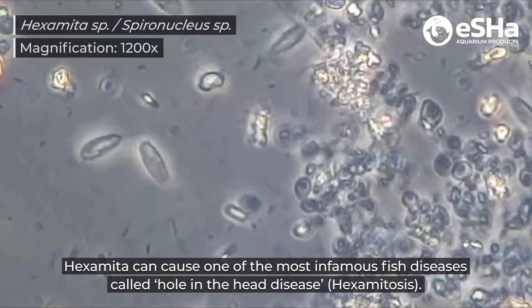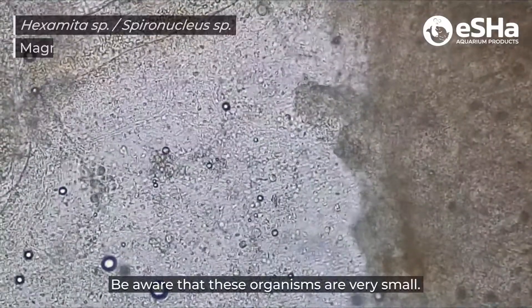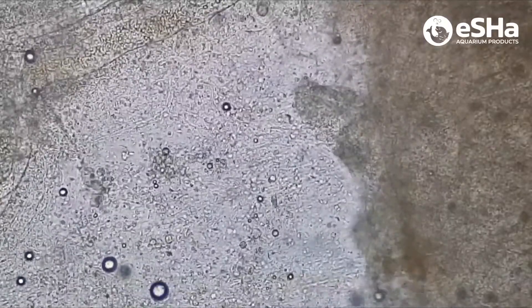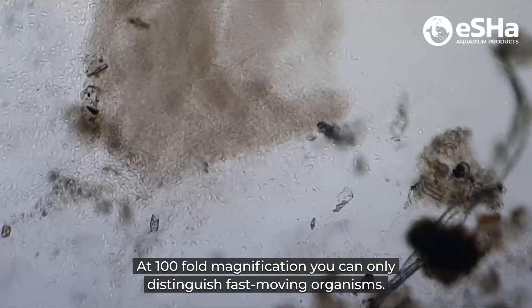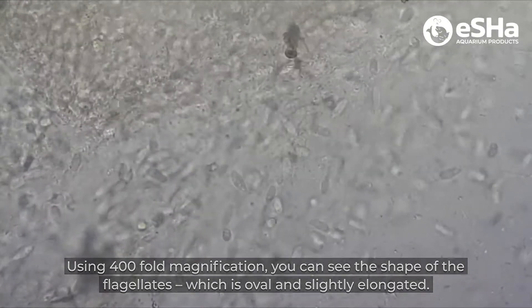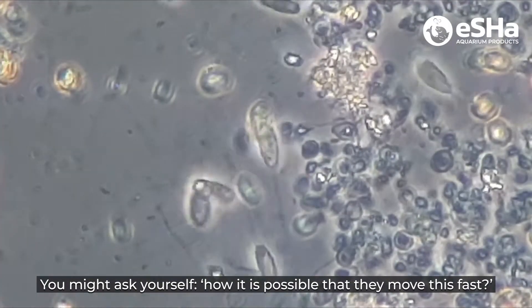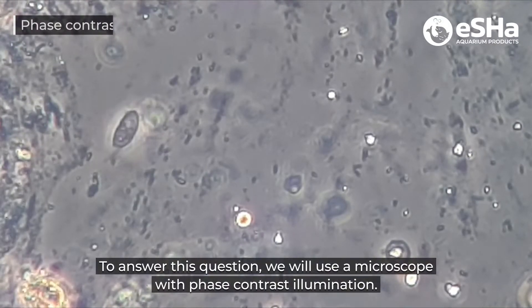Hexamita can cause one of the most infamous fish diseases called hole in the head disease. Be aware that these organisms are very small. At 100-fold magnification you can only distinguish fast moving organisms. Using 400-fold magnification you can see the shape of the flagellate, which is oval and slightly elongated. You might ask yourself how it is possible that they move this fast. To answer this question we will use a microscope with phase contrast illumination.